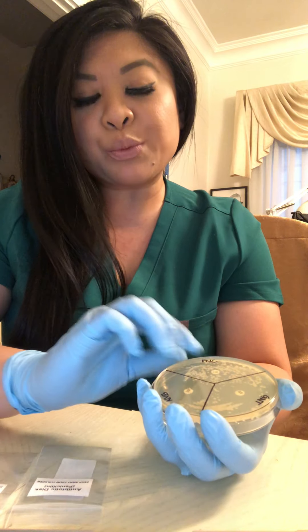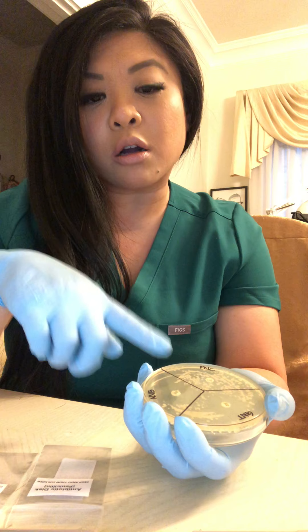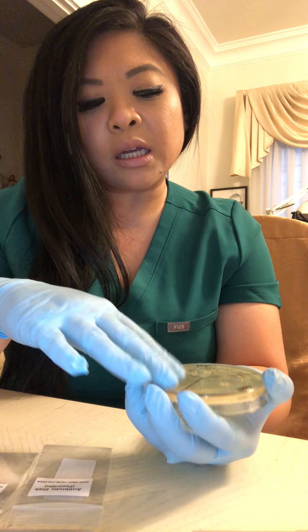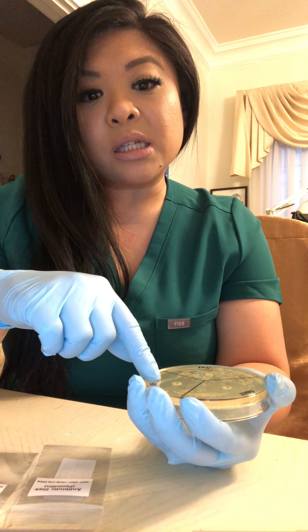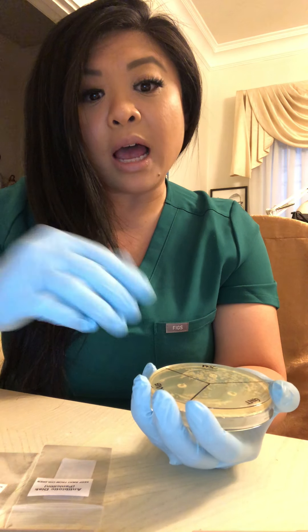During the experiment, when using the L-Spreader, we use it to spread the bacteria evenly across the agar plate, also known as the bacterial lawn. I was actually expecting some growth-like turbidity to indicate that there was bacteria on the plate, just like on the exploration portion of the lab.